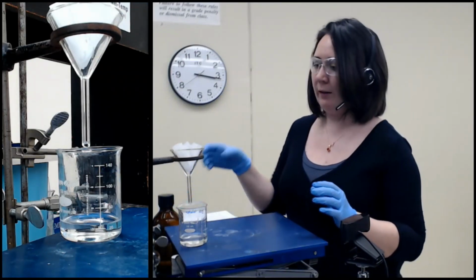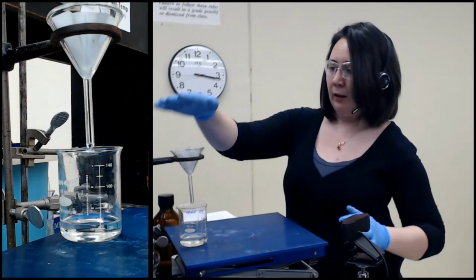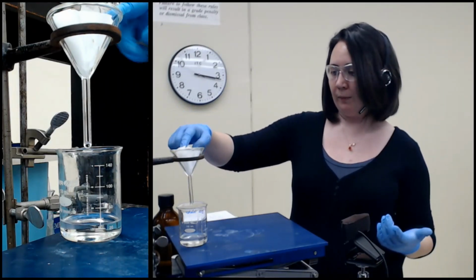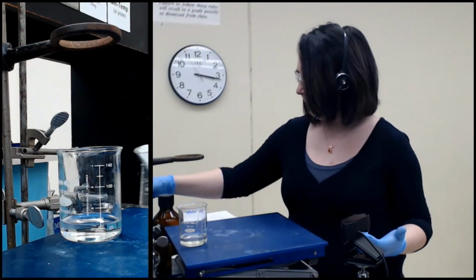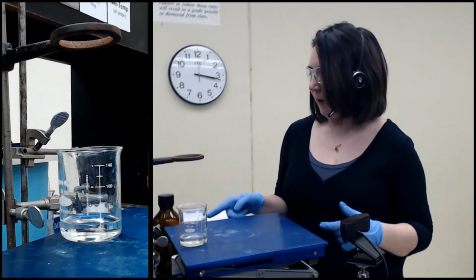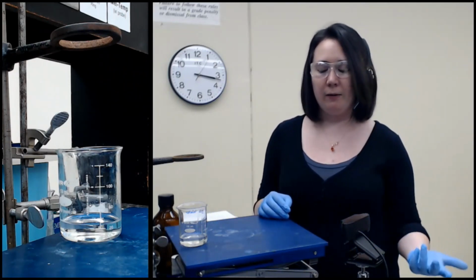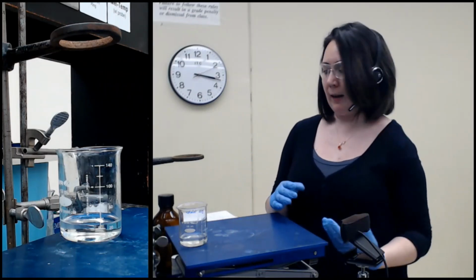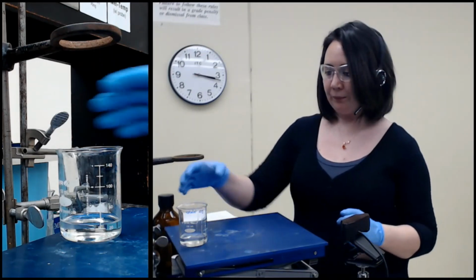So, that aside, what I'm doing is just checking that all the liquid has drained out from here. And I'm just going to leave the filter paper inside of this funnel and let it dry. I'm going to let it hang out to the side and begin drying on its own. This would be a great time to write on the funnel or the beaker that it's standing in what that actually is. So, solid left from ethyl acetate, step 2 in my notebook, something like that, just so that you come back later and you don't wonder, what is this thing that is in this beaker right here?